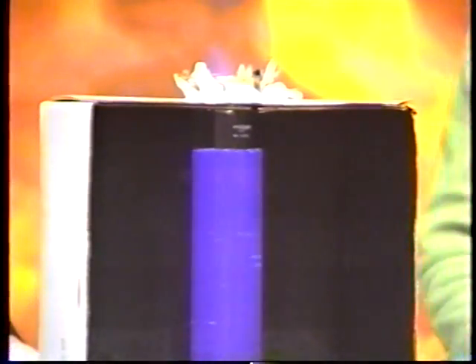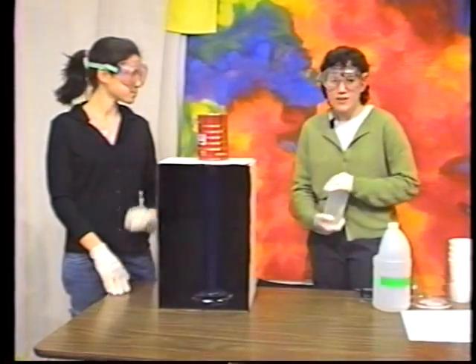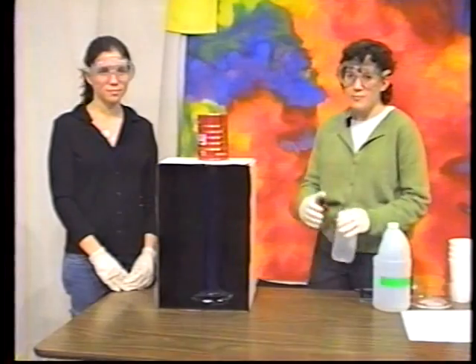This is called chemiluminescence. It's when a reaction occurs which gives off heat in the form of light. So, like the other reactions, instead of giving off heat, it gives off light. So that's why we call it that. It's an exothermic reaction. This is the same kind of chemical that is used in glow sticks that you might carry around on Halloween. And the same type of thing that's found in fireflies, which is the reason they glow too.